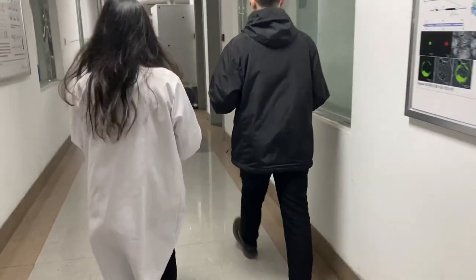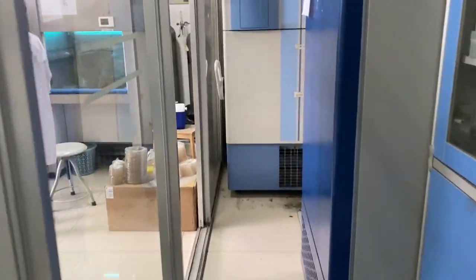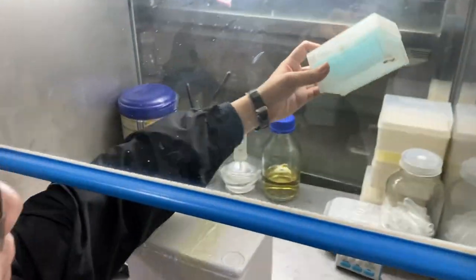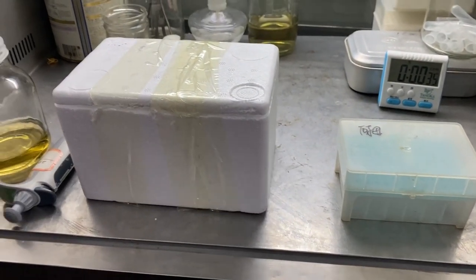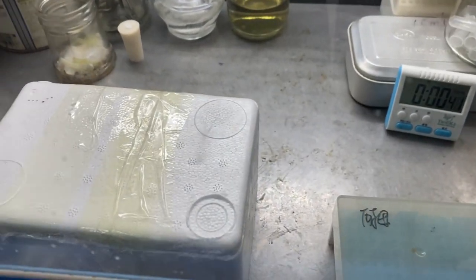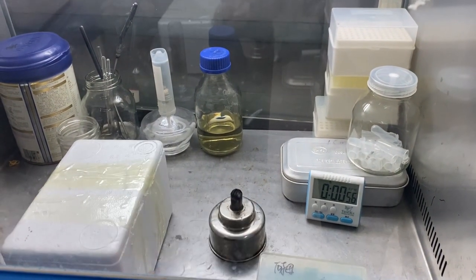After heat shock, 700 µL of LB media should be transferred into the tube containing the vector and cleaved gene. You can transfer 700 µL of LB media under sterile conditions.